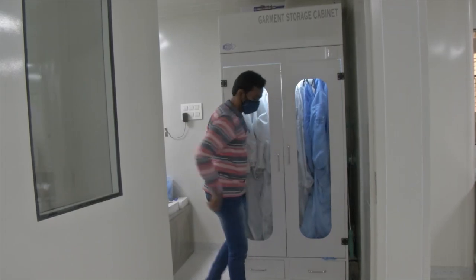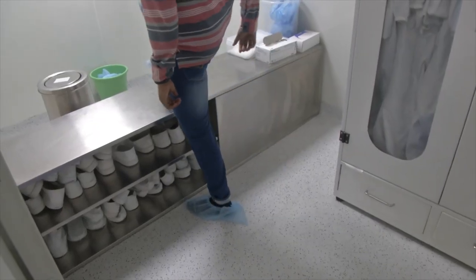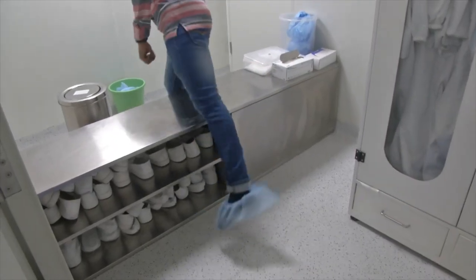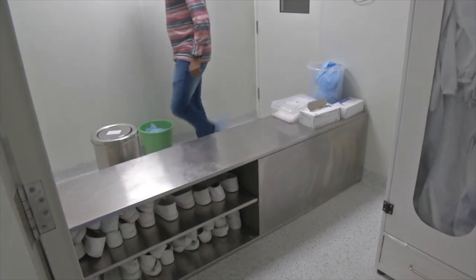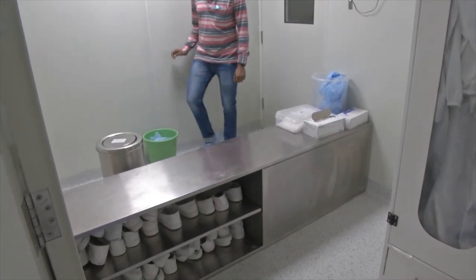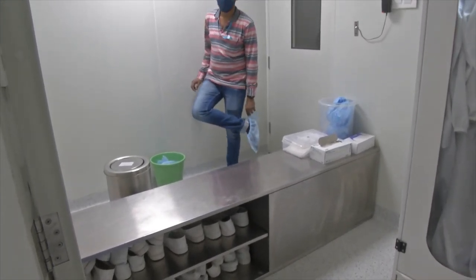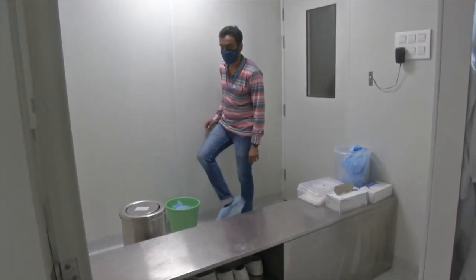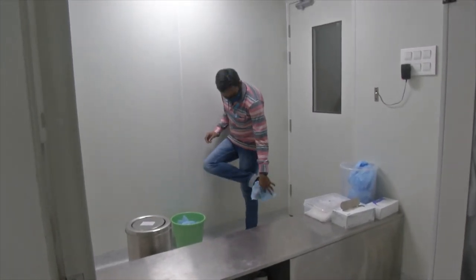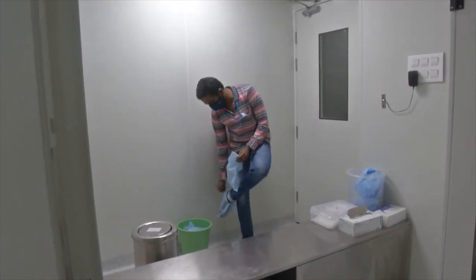The final step before exiting the clean room is to remove the shoe cover. It is important to remove the shoe cover after crossing the bench. The bench acts as a barrier to prevent any kind of dust from the socks or from the feet of the user.